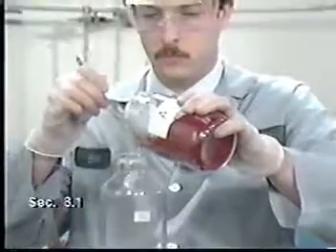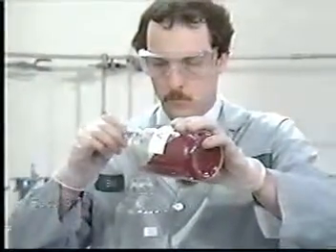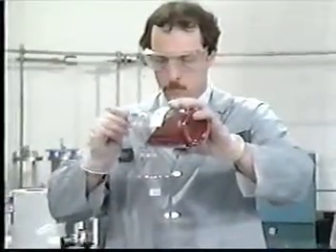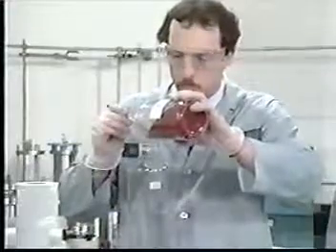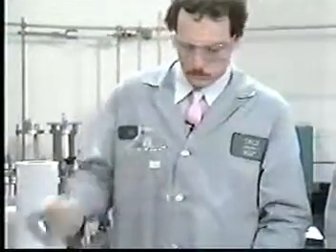Wastes, which are 100% solid, like waste A here, can be extracted without first separating the liquid and solid phases. Bearing in mind how much of these entirely solid wastes will be needed for extraction, weigh out at least 100 grams of sample and record the amount used.